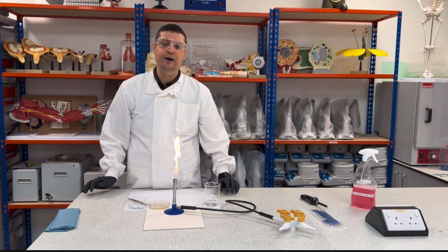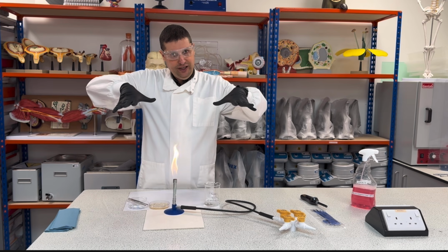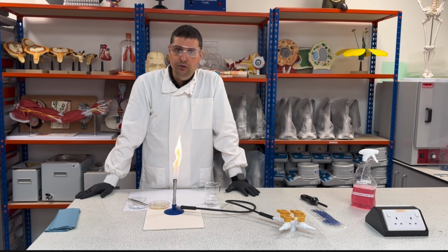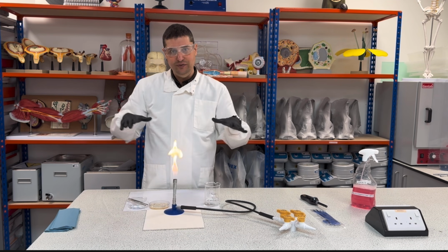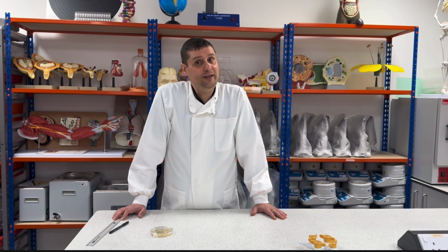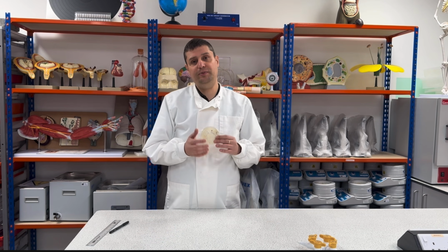Why do I need to press the antibiotic in the agar? To guarantee the agar will have contact with the antibiotic and the substance will go for the agar. If the antibiotic is not touching, you might have a false positive or a false negative. So guarantee all the antibiotic discs is touching the surface of the agar. That's the very important part of this process. Okay. After the incubation time, that can take between 1 to 3 days, depending on the temperature, we will have the results.